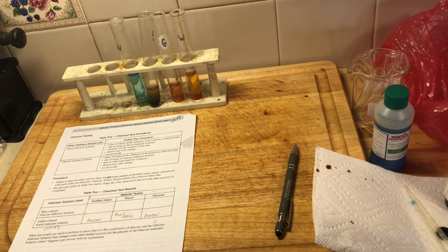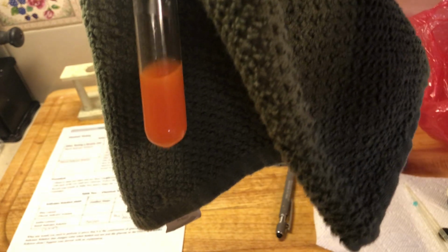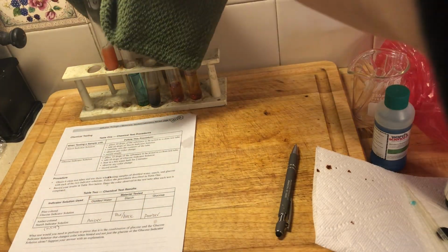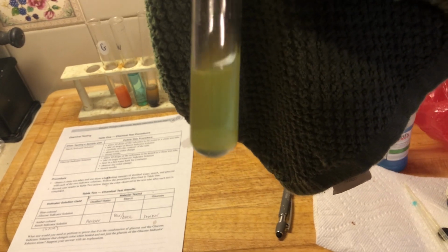All right. So we did have an anomaly happen. I don't know what happened, maybe because I messed up my test tubes, but here's our glucose test tube, and there was a color change. That is because there's glucose present in this test tube, right? So it did turn into an orange color. And then our starch one did a little something different here. So there might have been some glucose in this tube, or I might have messed up my pipettes, but our starch tube should have stayed blue. It's kind of a green color right now.